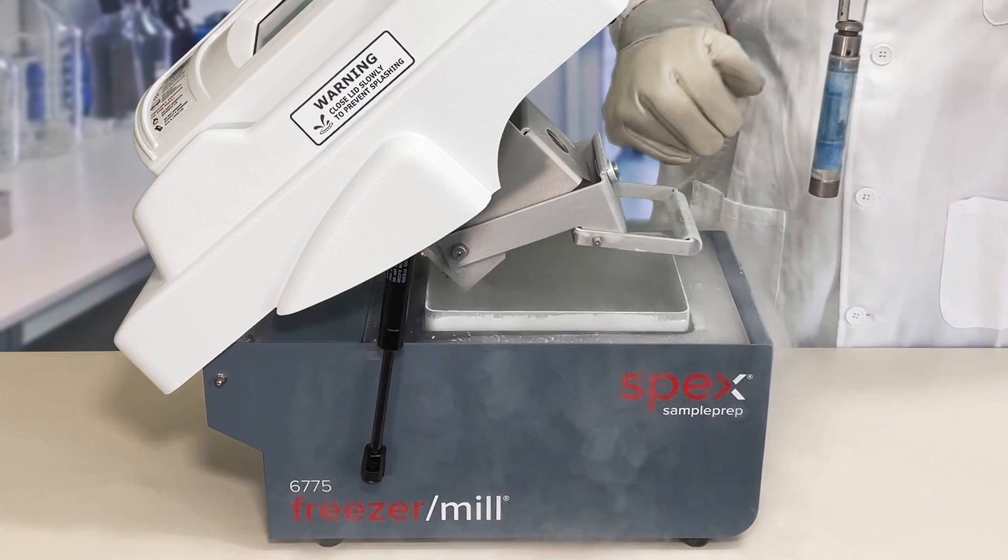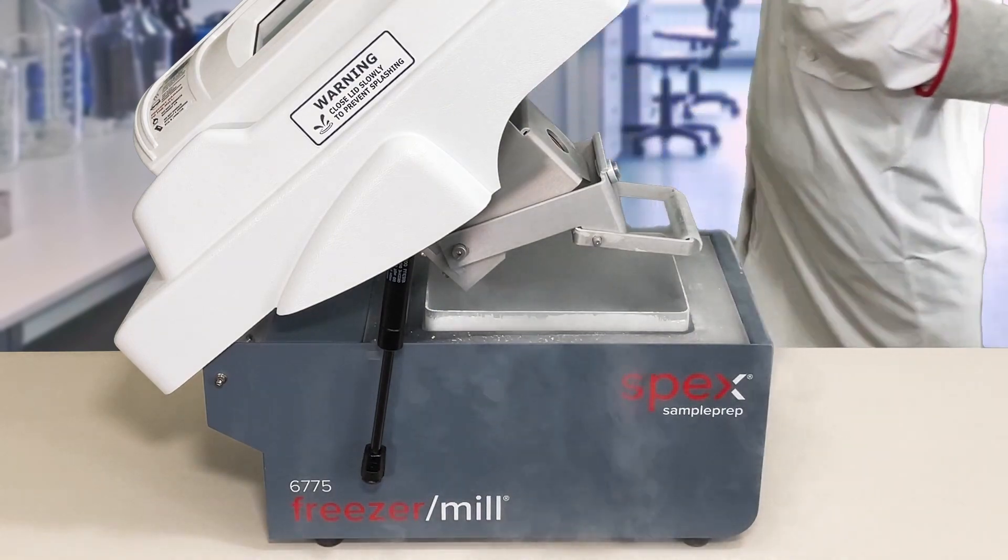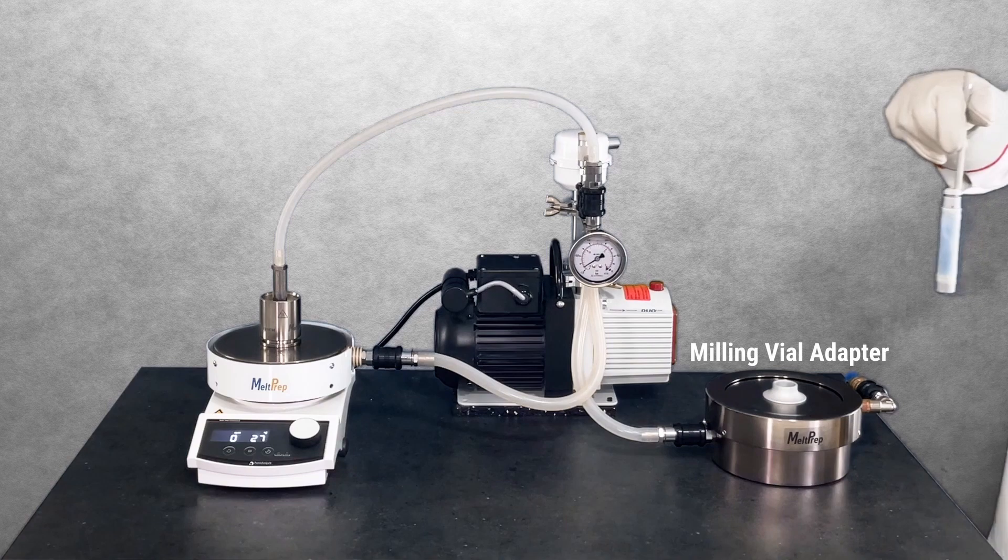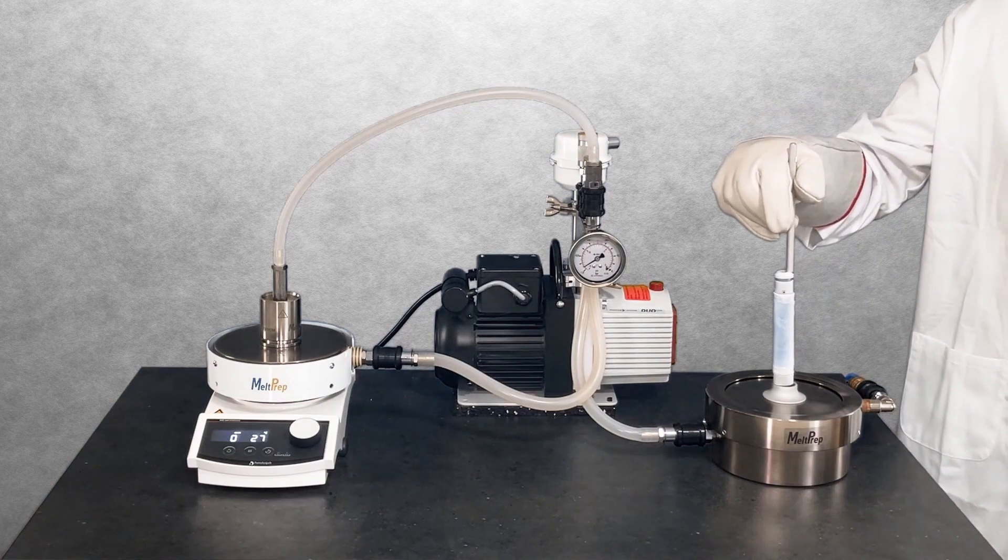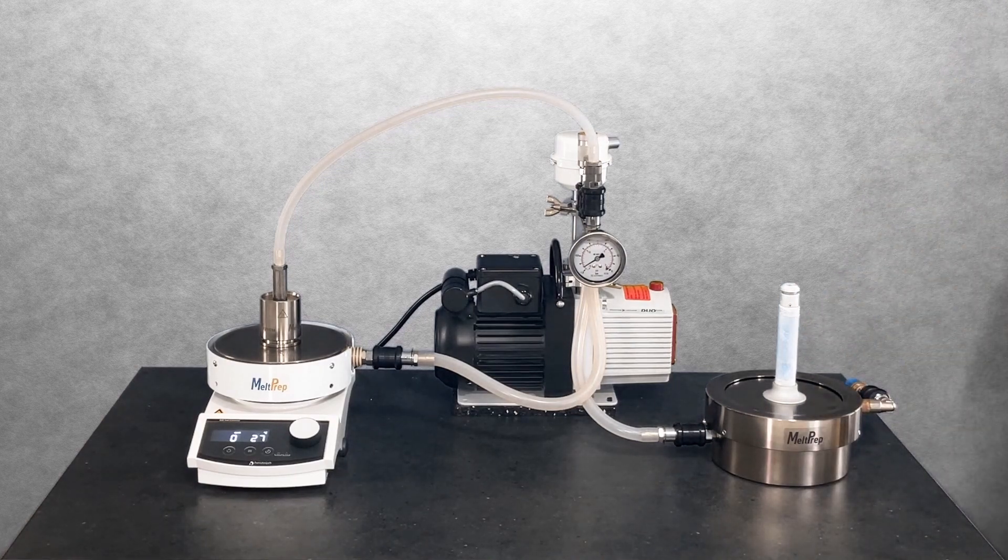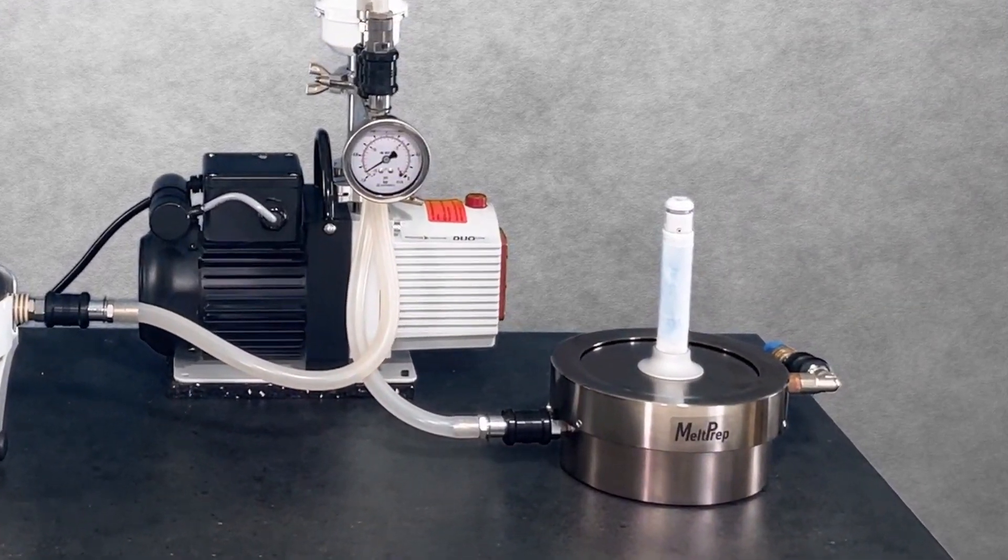A good practice is repurposing the VCM Essentials cooling unit to warm up the milling vial. Start by vacuum-clamping the milling vial adapter on the cooling unit and place the vial inside. Engage the compressed air to bring it back to room temperature.